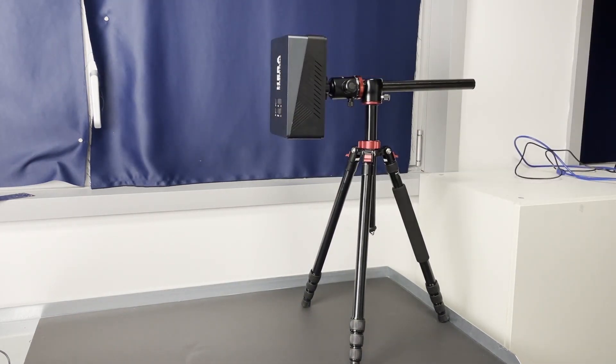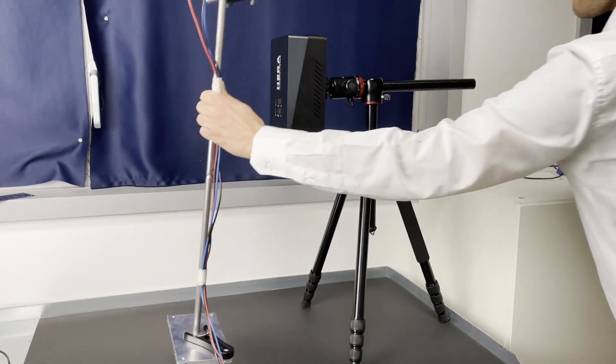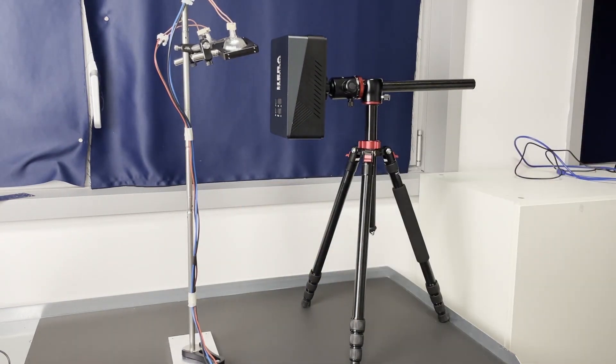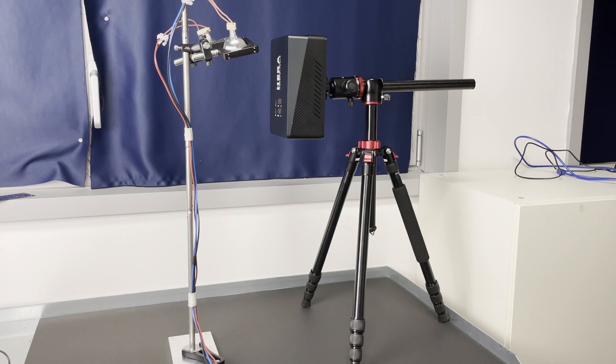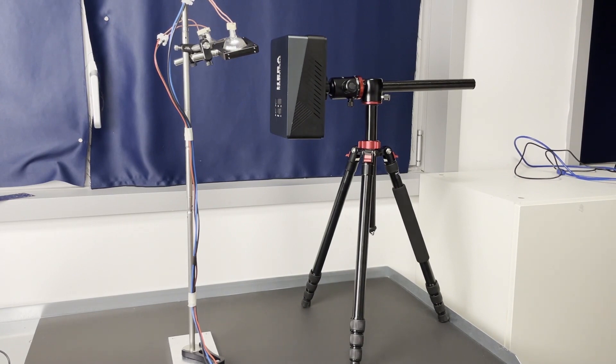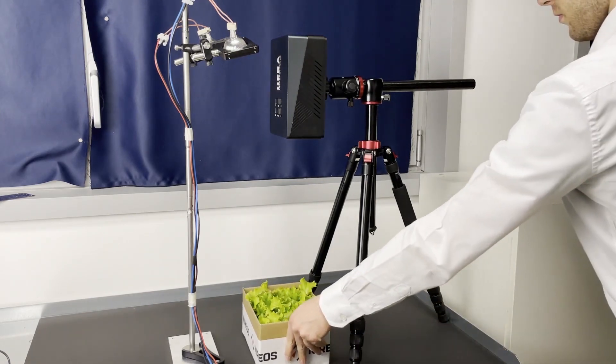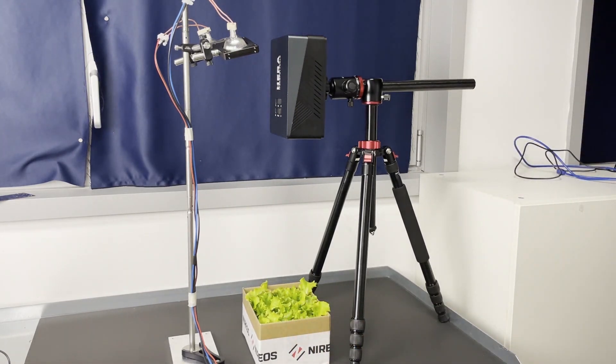Concerning the illumination, we are now using a couple of 20 watt halogen lamps. In general, the high sensitivity of the camera enables one to use low light conditions and illuminations, and this can be very helpful when you have delicate samples and you don't want to damage them or heat them.